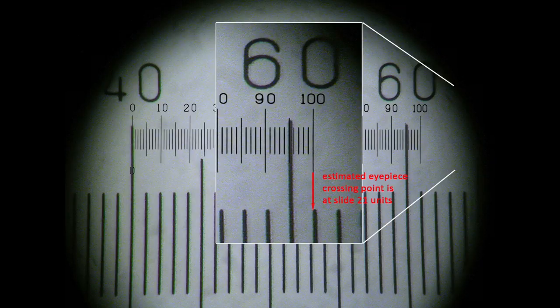But whatever degree of refinement you apply, be consistent. This will become even more important when using the 100x objective later.